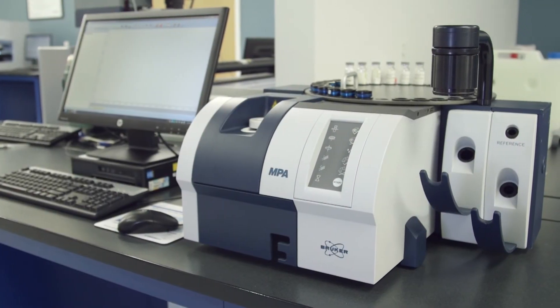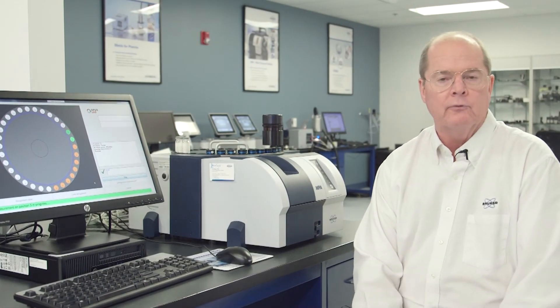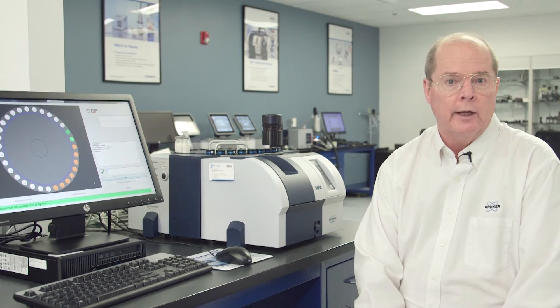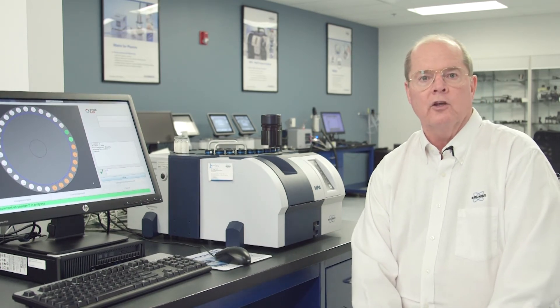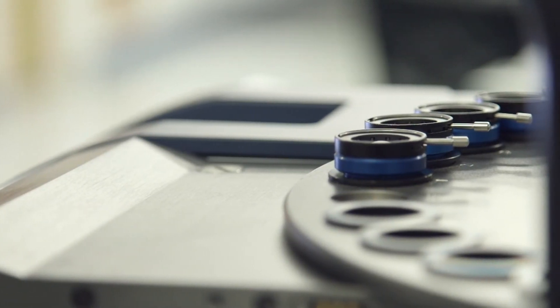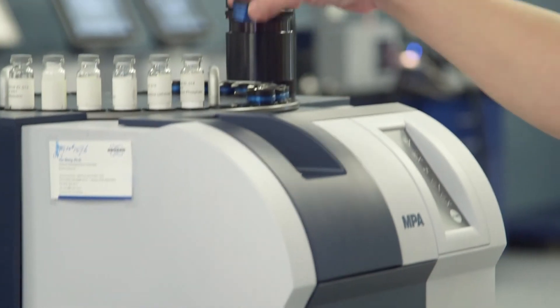Once the quantitative methods or conformity test methods have been established for a particular type of tablet, analyzing the tablets in a manufacturing QA environment is very easy. You just fill in the auto sampler tables with the ID for each one of the tablets, fill the tablet holders that mask the beam so we don't get stray light surrounding the sample, and proceed with the measurement.